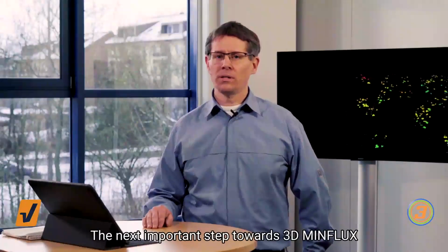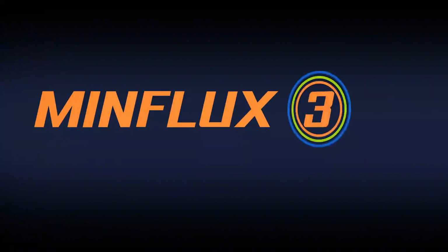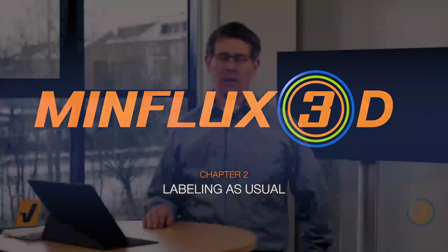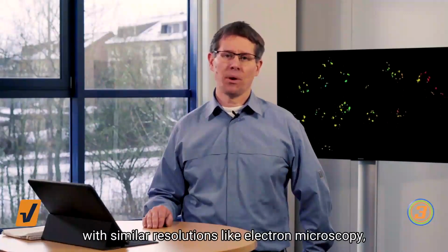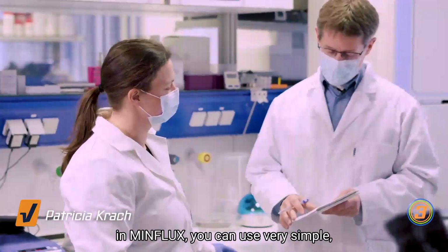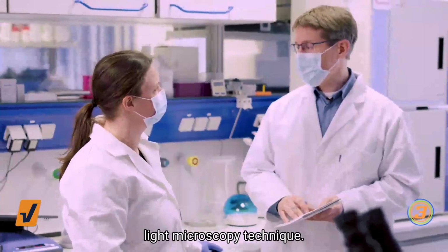The next important step towards 3D MINFLUX imaging is sample preparation. Unlike sample preparation for techniques with similar resolutions like electron microscopy, where it might take weeks of sample preparation, in MINFLUX you can use very simple, straightforward sample preparation techniques, like for any other conventional light microscopy technique.